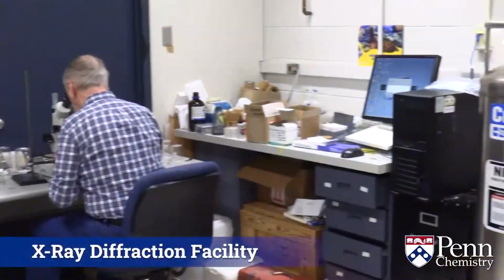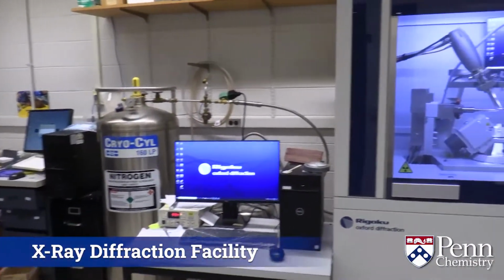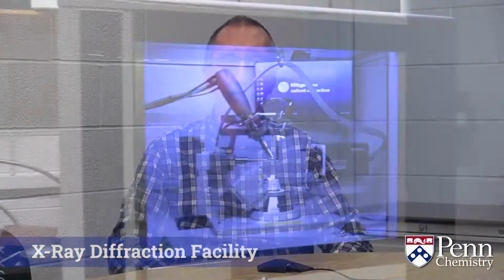I am Pat Carroll. I'm the director of the facility and have been since 1980. What we do in this facility is use X-rays and crystals and the process of diffraction in order to determine the structure of chemical molecules.